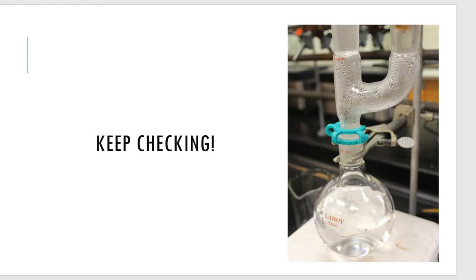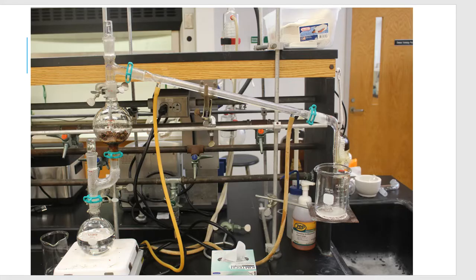Constantly check on the Florence flask and make sure your water level is not getting really low. If it does, fill it with room temperature water — which will take a little longer to boil and restart the process, so we don't want to do this unless absolutely necessary. One more hour into the process: the entire setup as it's distilling — water, Claisen condenser, biomass flask with the clove, sidearm adapter, west condenser, drip adapter, and the receiving beaker on this side getting cloudy liquid.